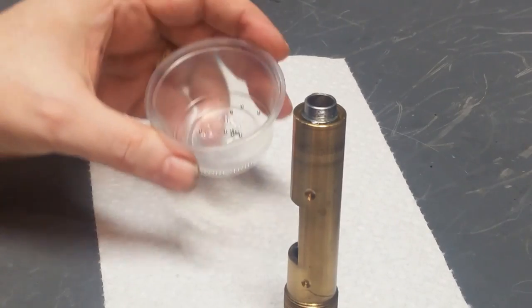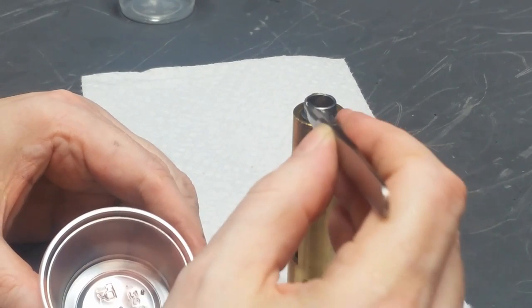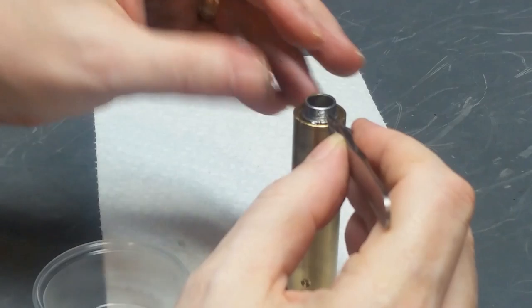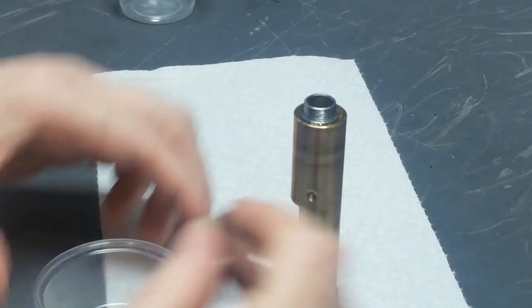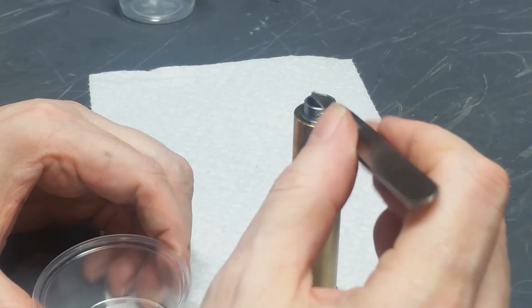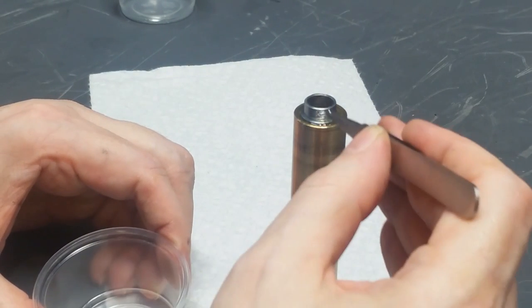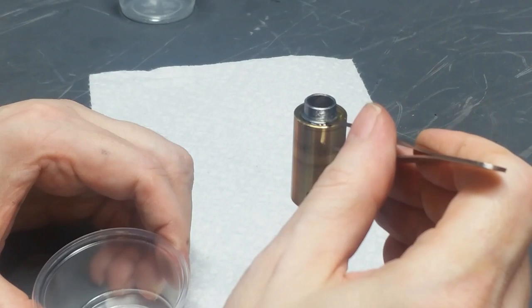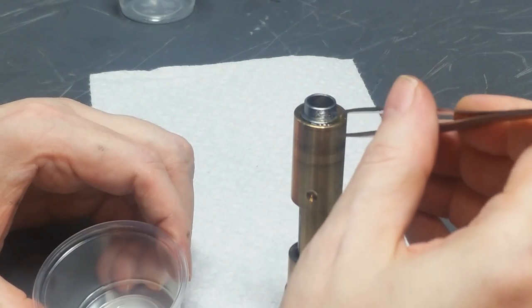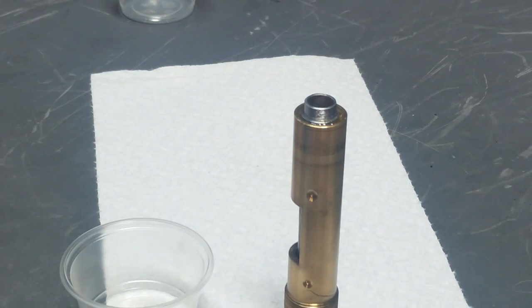I'm going to drop these 30 bearings into the grease. I'm going to start, let you see me get started, but I'm not going to make you watch the whole thing because it's a little boring. It's bad enough to actually have to put these in there. It's probably going to be way worse to actually watch it. Okay, there's the first few. I'll be back when it's done.